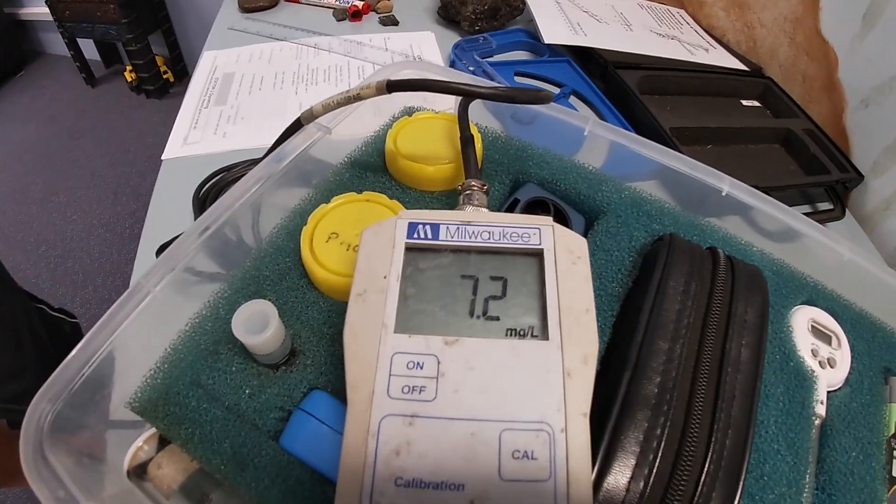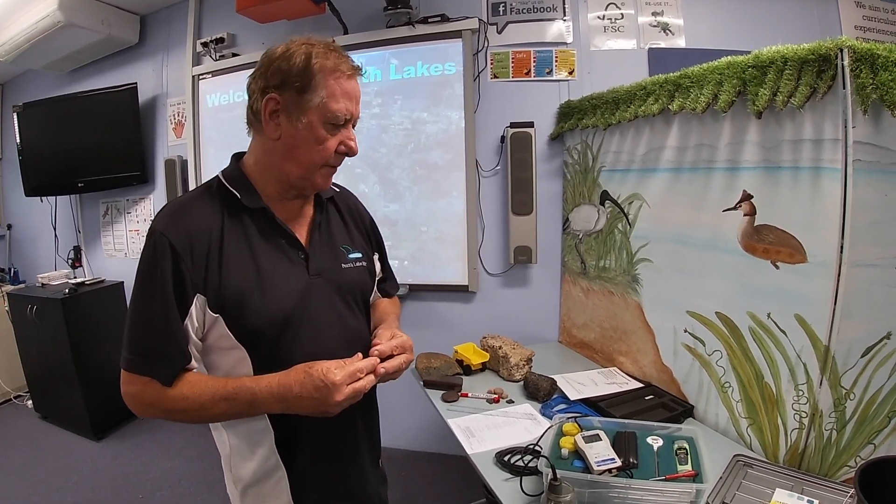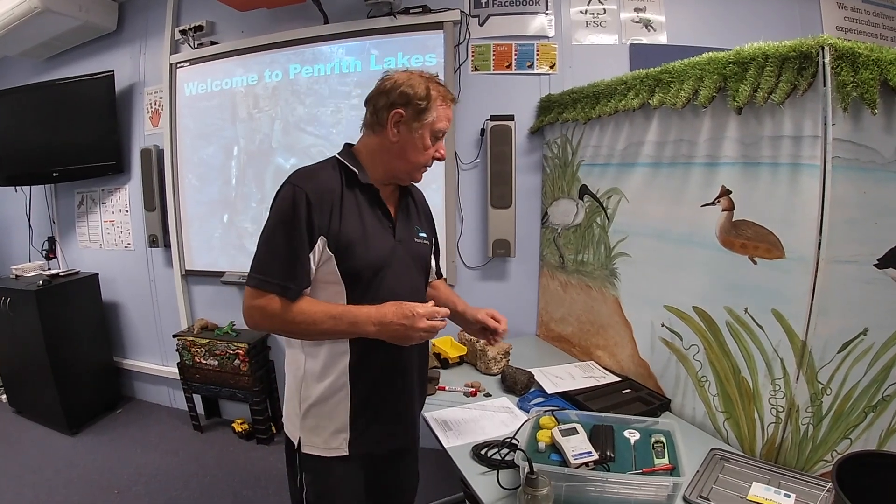You can see it is at the moment about 7.2 milligrams per litre. Now that's fine, but we also need to adjust our reading because a very important variable for oxygen in the water is the water temperature. Basically cold water can hold more oxygen than hot water, because cold water is denser. So we've got to make an adjustment for the temperature, but we don't have to do a calculation.